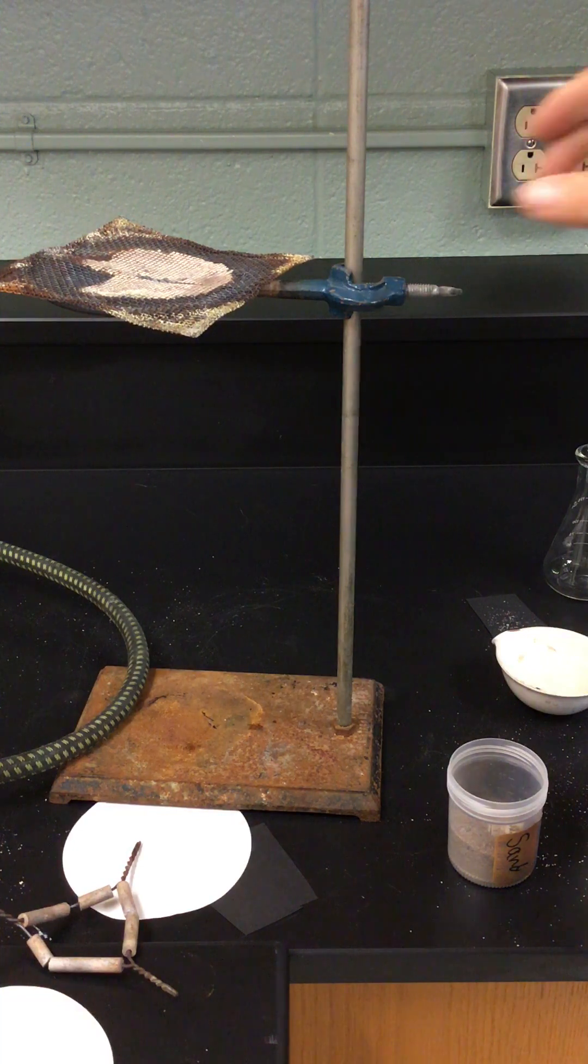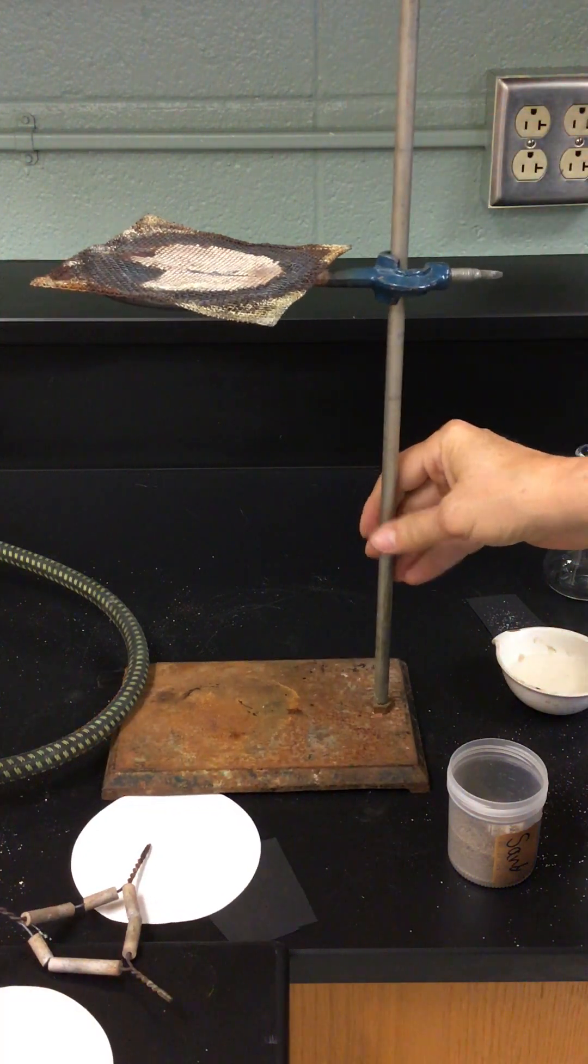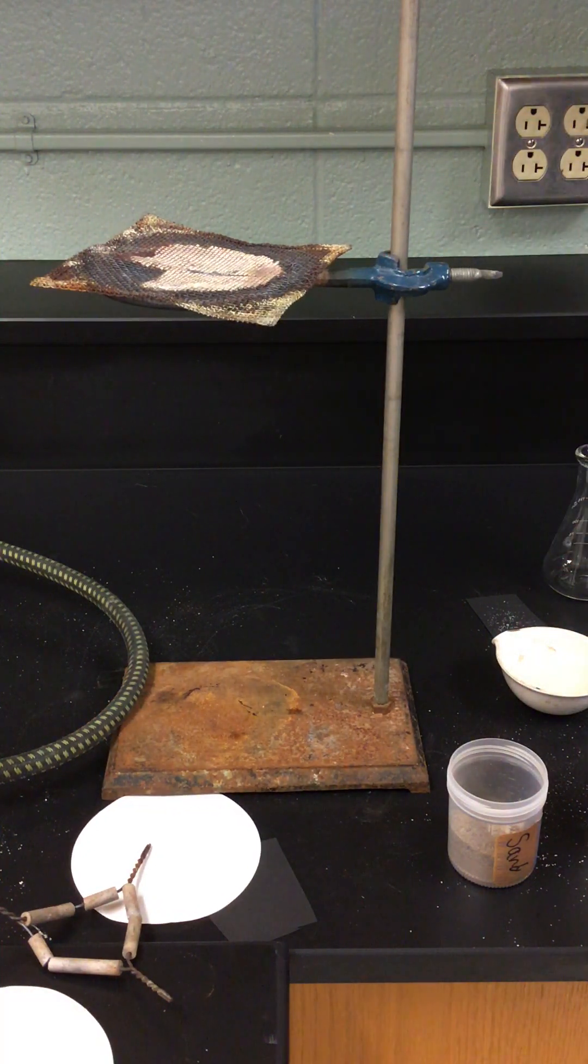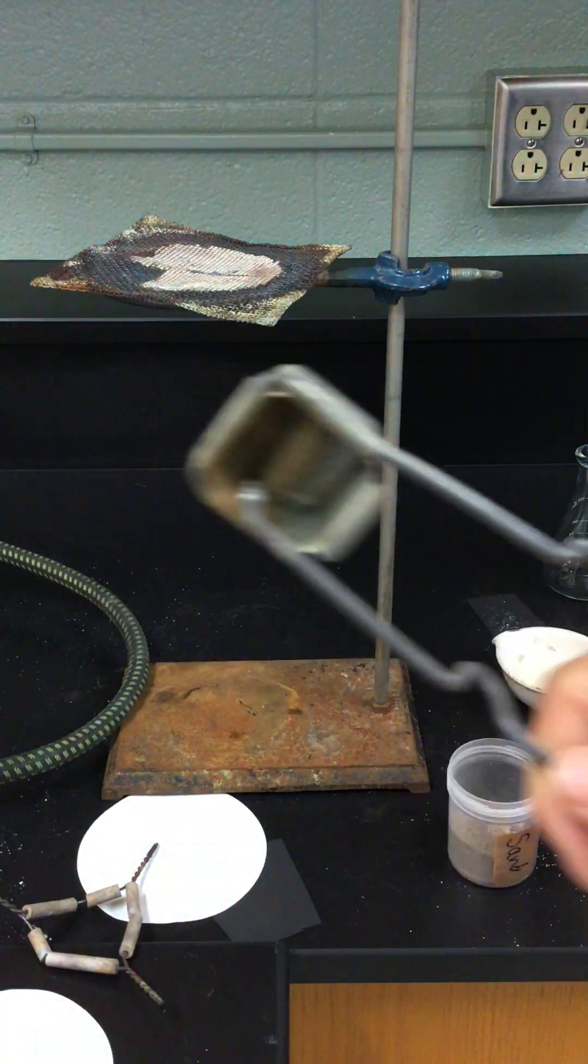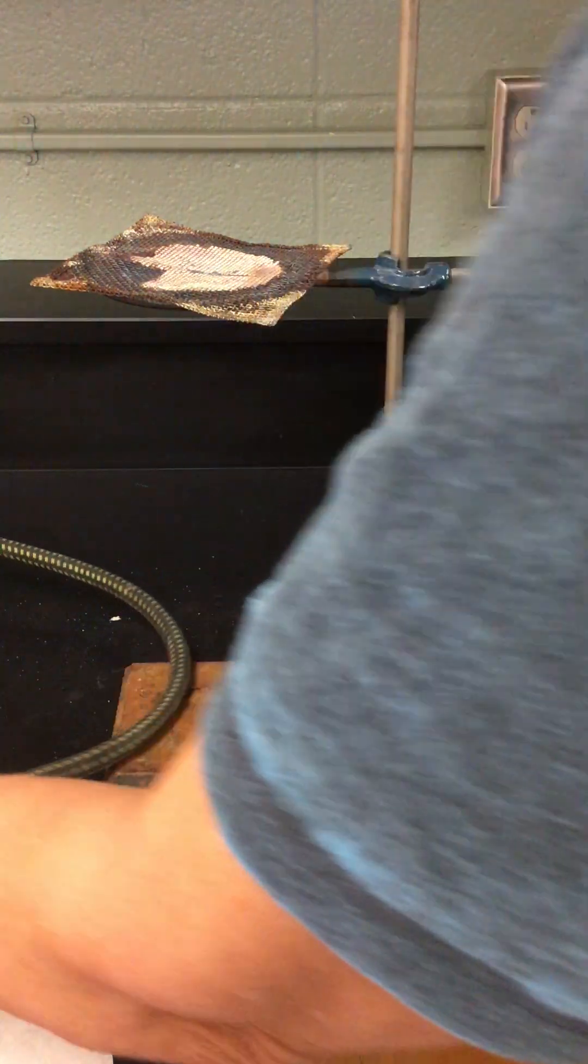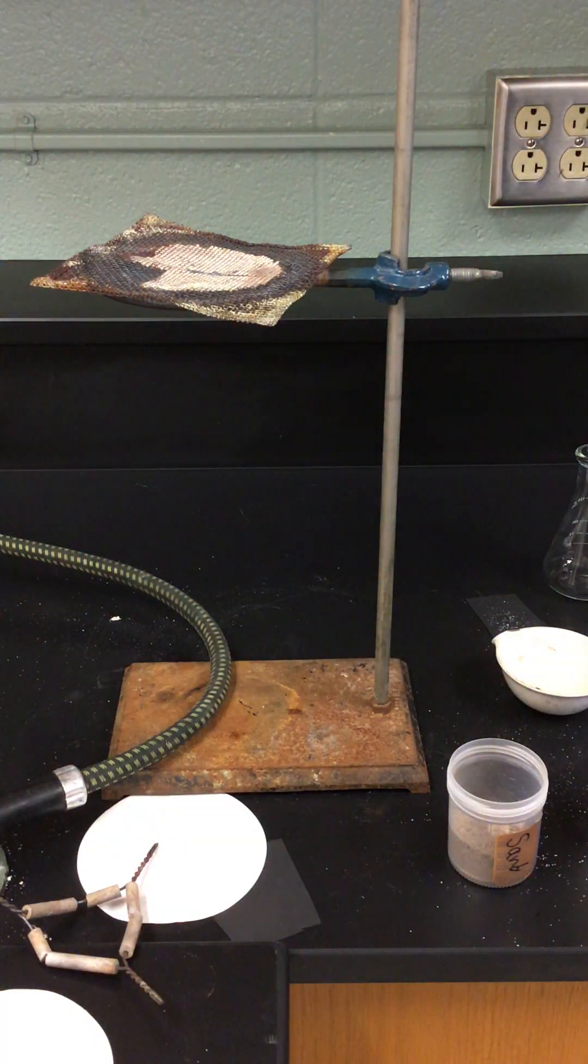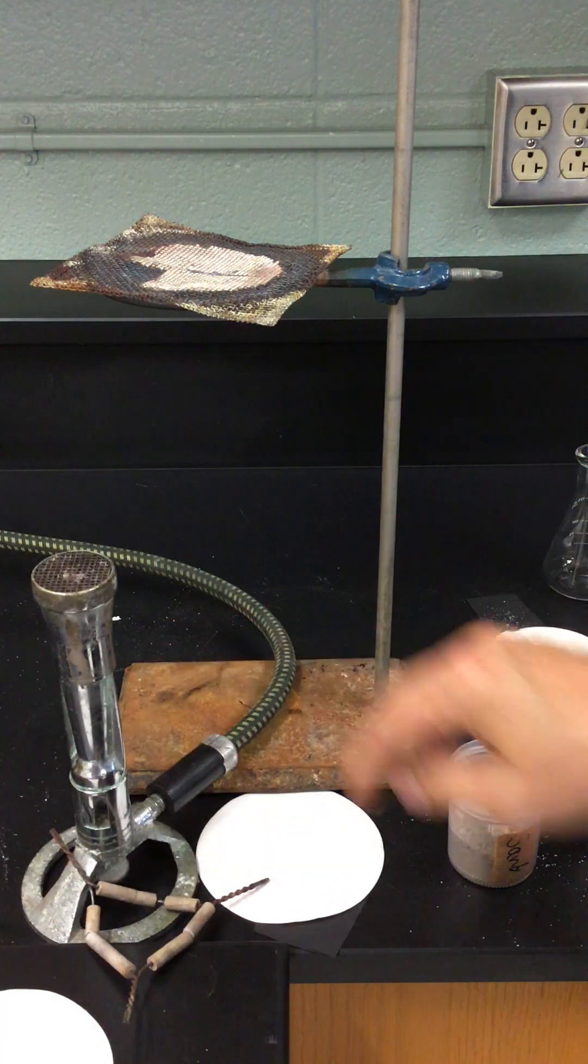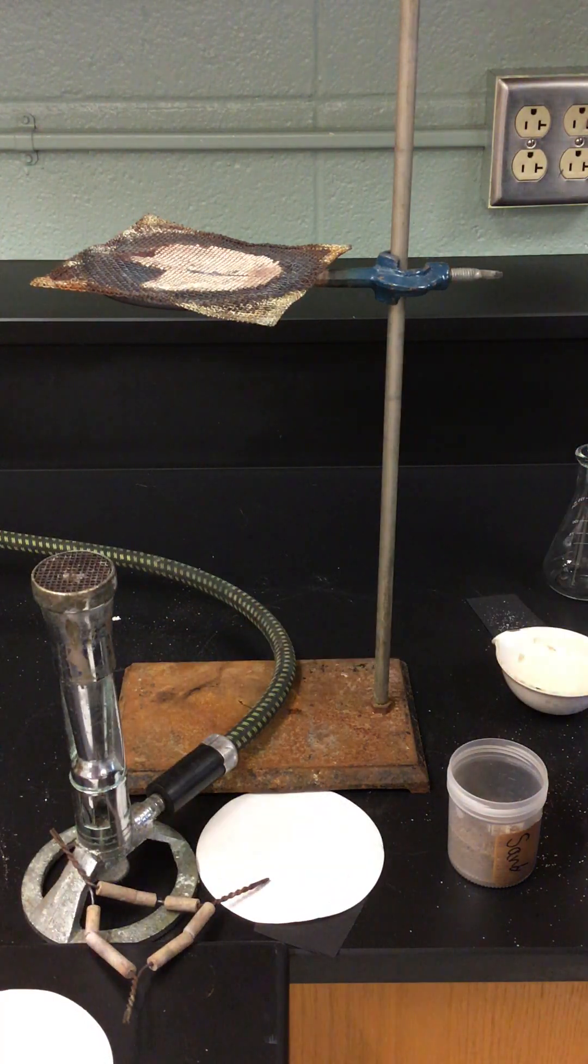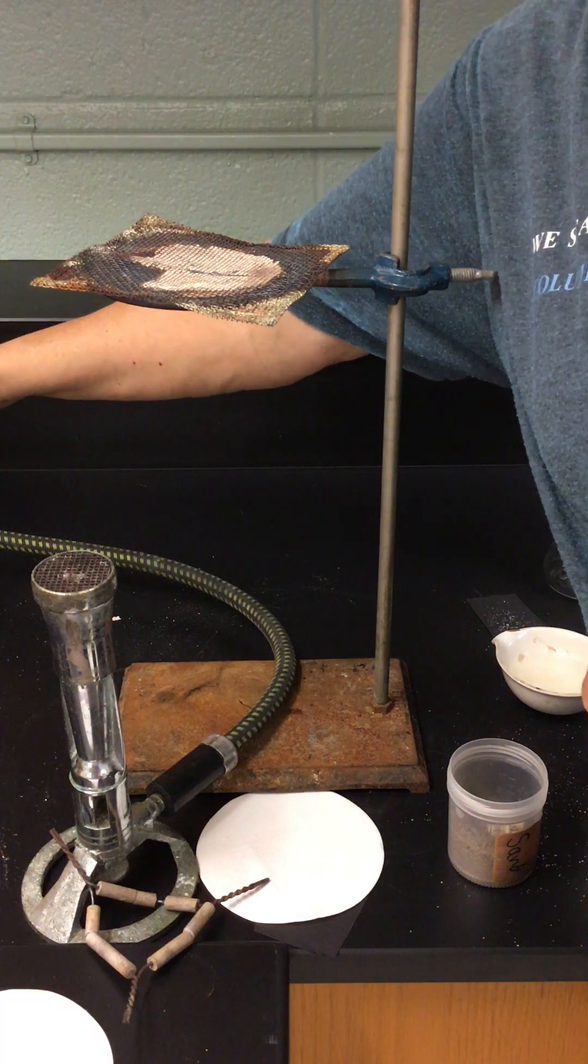I don't usually do that till later because I don't want to accidentally knock it over. What I'm going to do now is light the burner. I'm going to light the burner using this striker. I'm going to turn the gas on way back over here. You'll hear it.